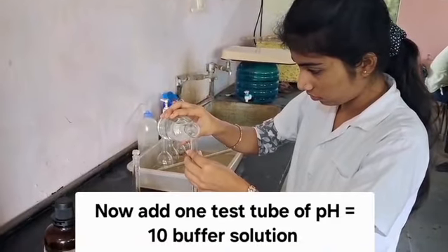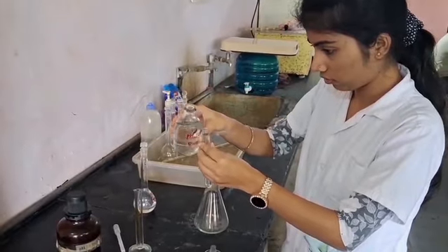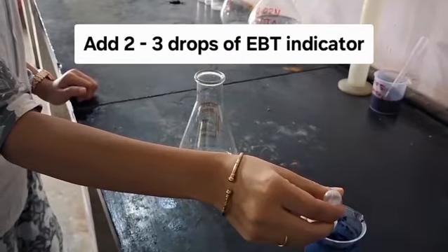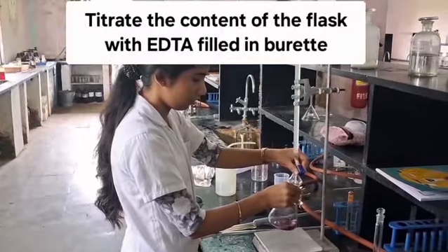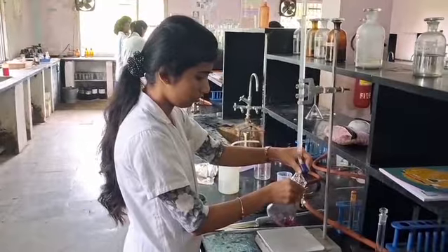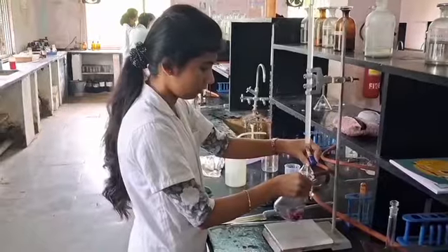Add 1 test tube of pH 10 buffer solution to the same conical flask. Then add 2 to 3 drops of EBT indicator. Titrate the contents of the flask with 0.02 molar EDTA solution till the endpoint changes from wine red to blue.